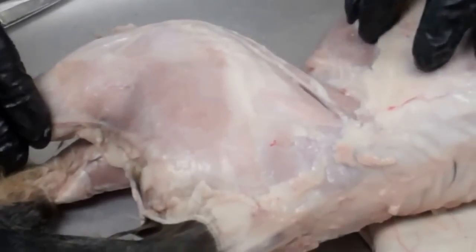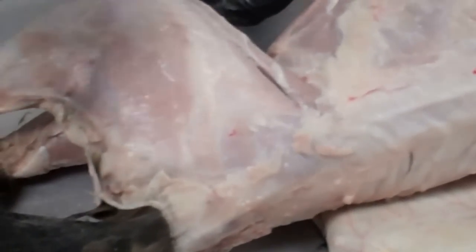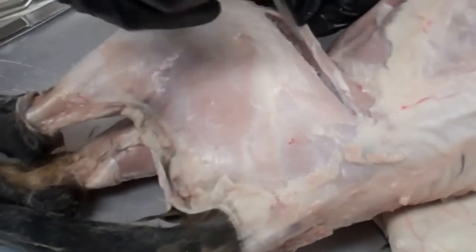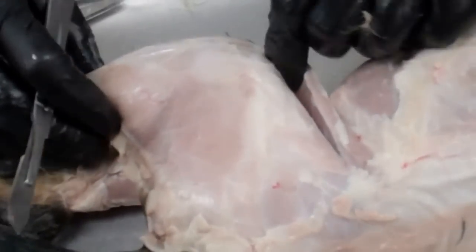To find the muscles on the lateral side, first of all this muscle is the sartorius coming over here. We're just going to free that one up — that's the sartorius muscle. You'll see that much better from the front side.